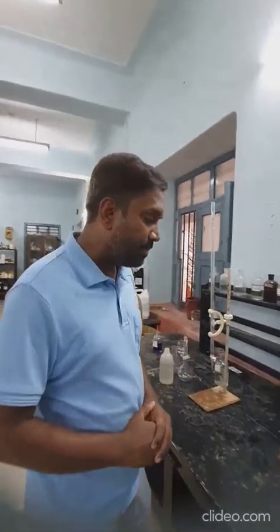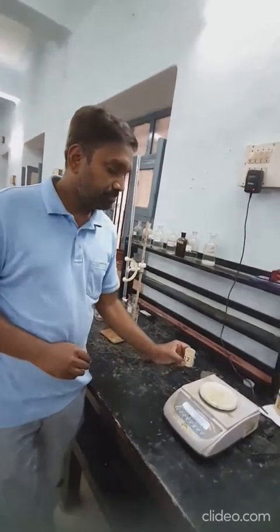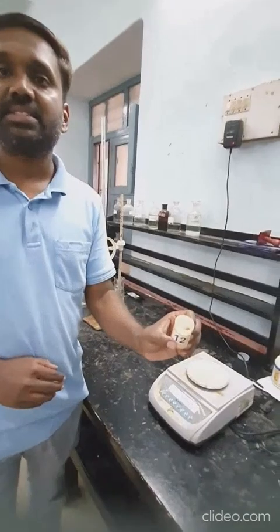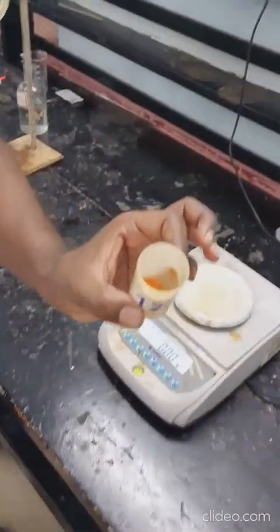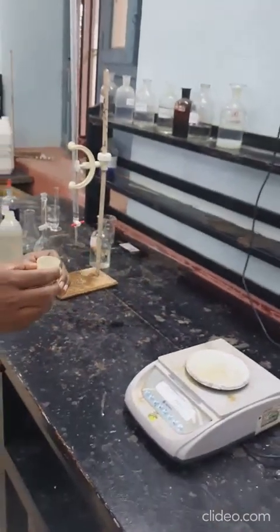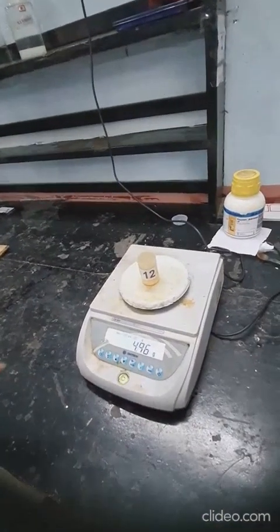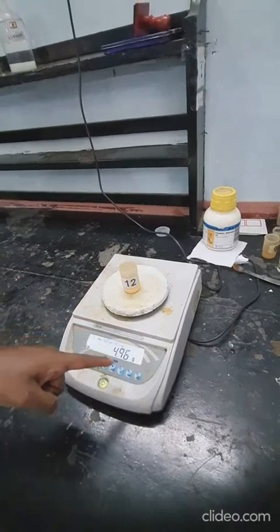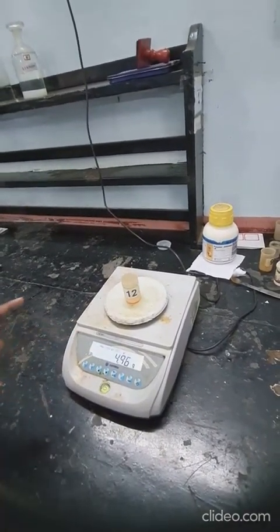For this, in the lab, you will be supplied with a bottle which already contains a pre-weighed amount of potassium dichromate. This bottle should be weighed first, and the weight of the bottle plus potassium dichromate should be noted and written in your booklet in the examination.